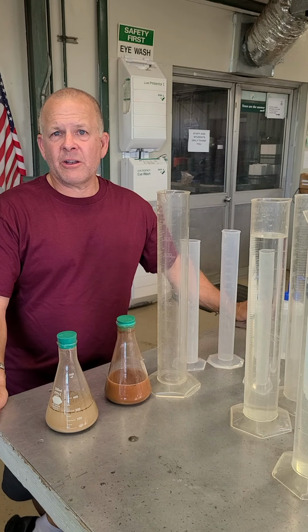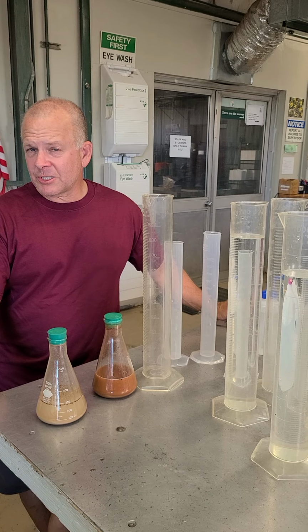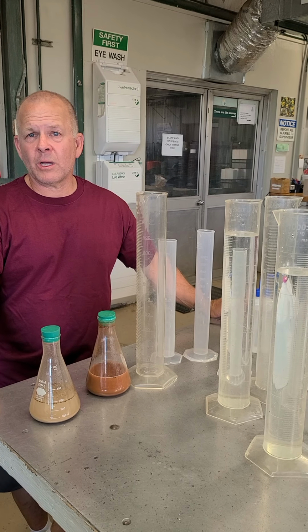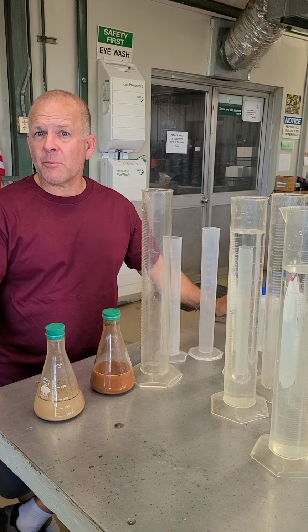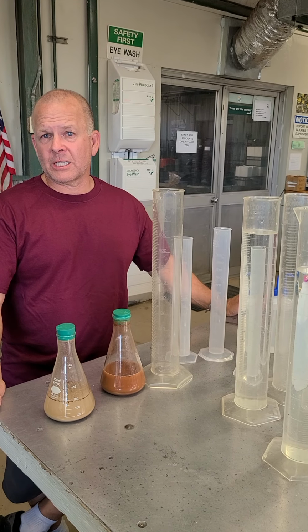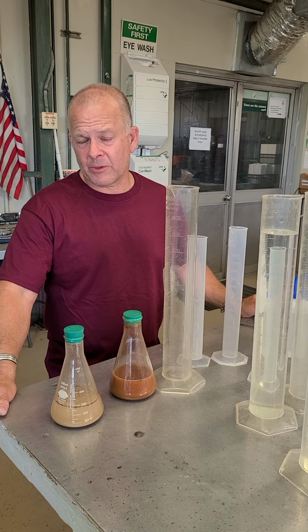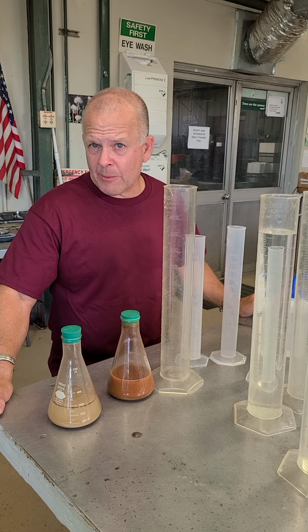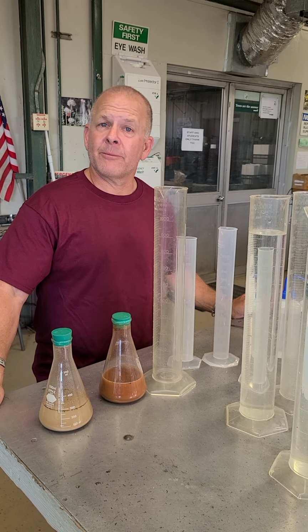This is AGNR 131 Soil Science Lab, and this is lab exercise 3, part 1, where we actually run the soil hydrometer. We do the hydrometer method to determine soil texture. So you remember from the last video that we showed you how to prepare the soil samples, and today we're actually going to run the two soil samples that we prepared.